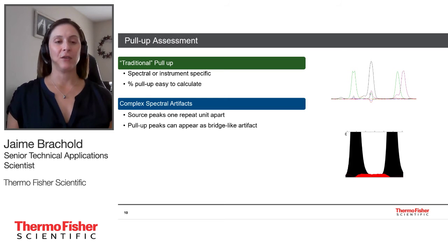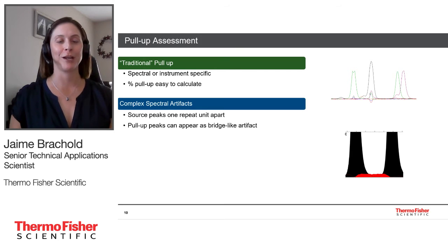Okay, I use this term complex spectral artifacts when I start talking about the results of the study, so I just want to make sure everyone's on the same page with what I mean. So traditional pull-up, that's pull-up that I'm going to be talking about. That is pull-up that falls underneath a parent peak. It's very easy to calculate a pull-up percentage, so like the top figure that you see here.